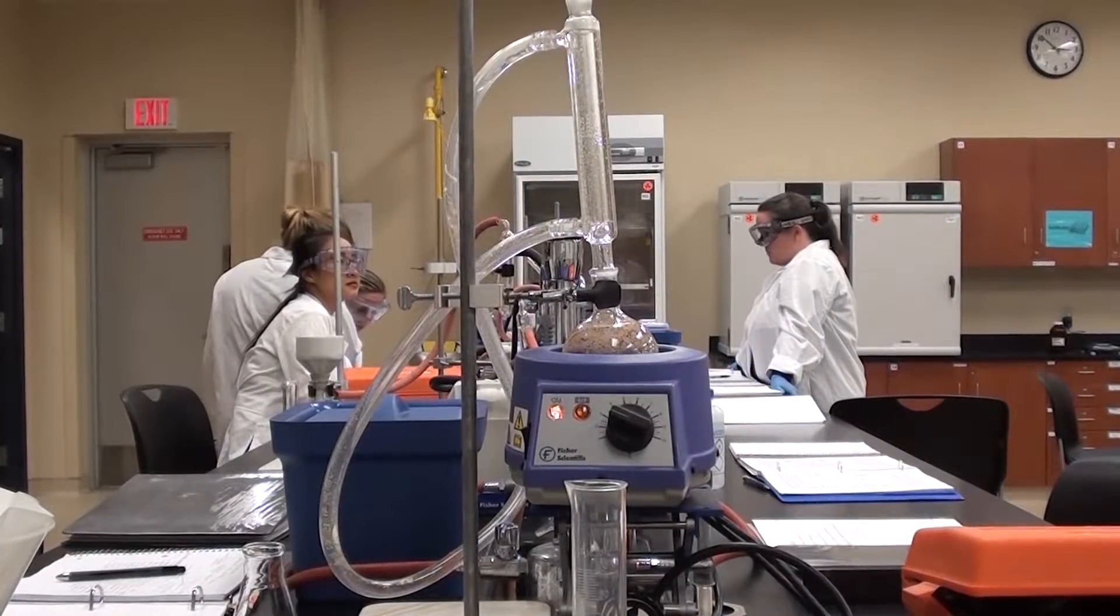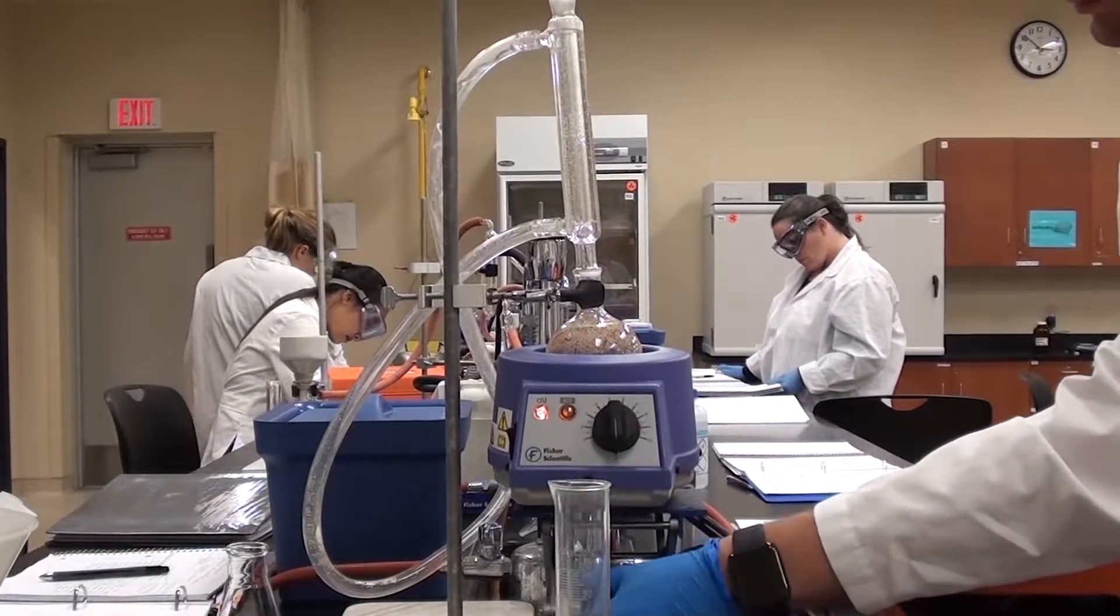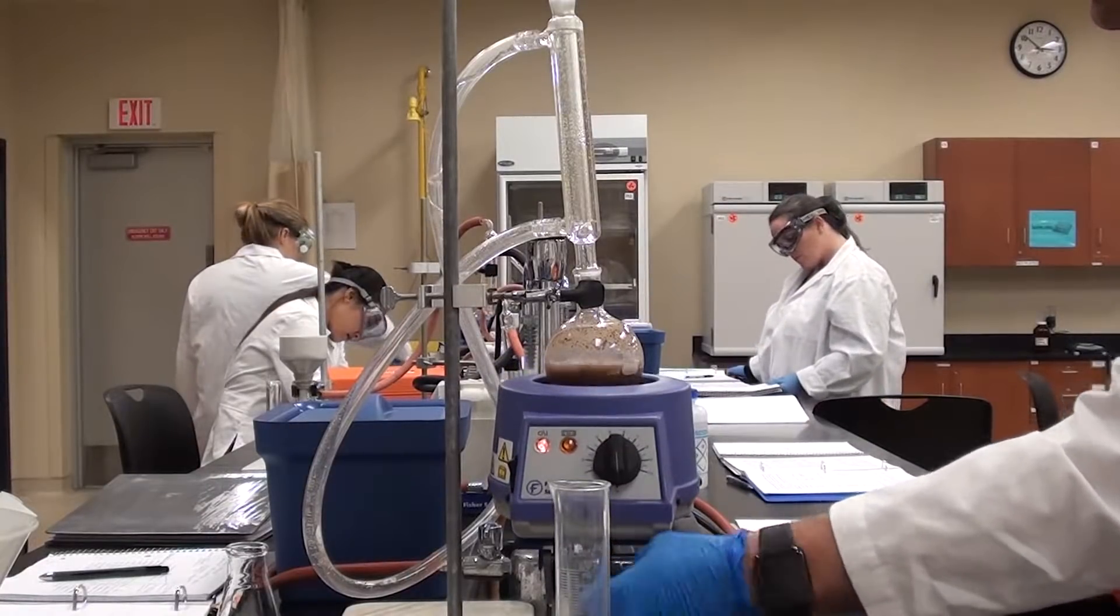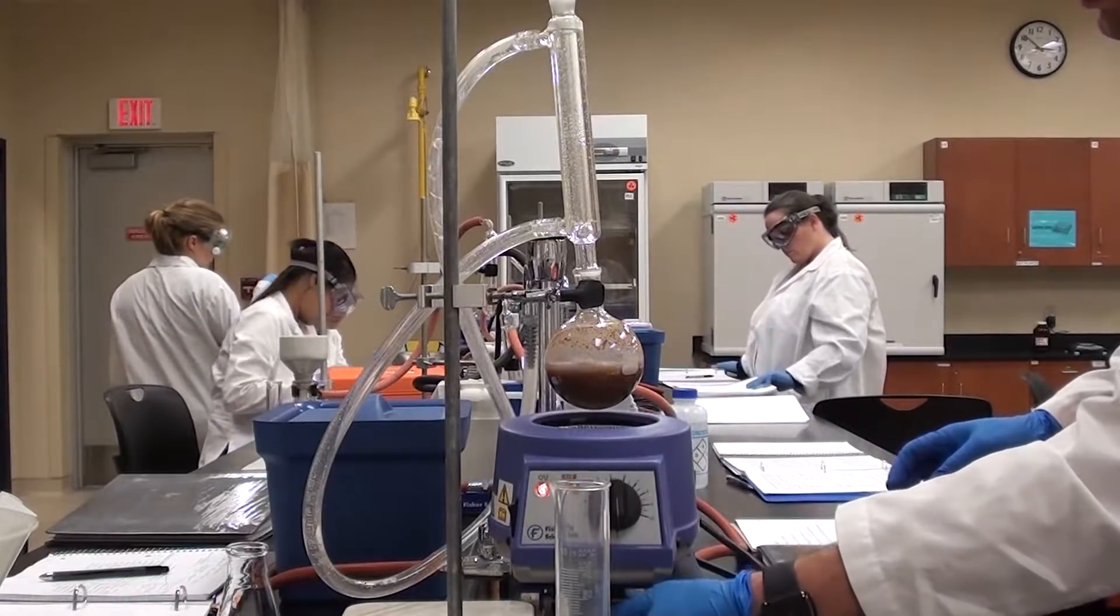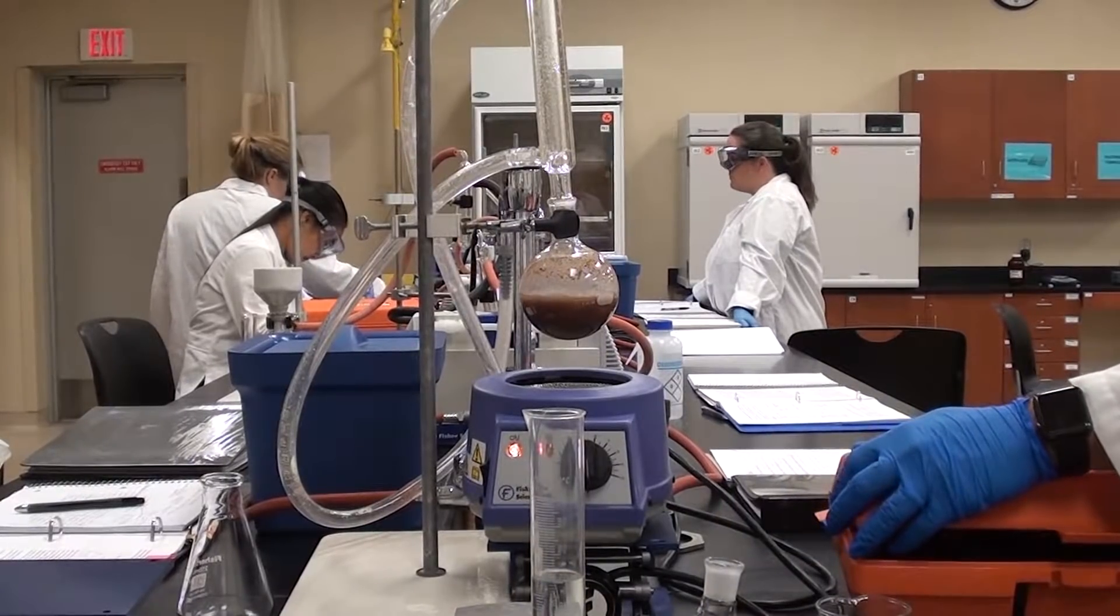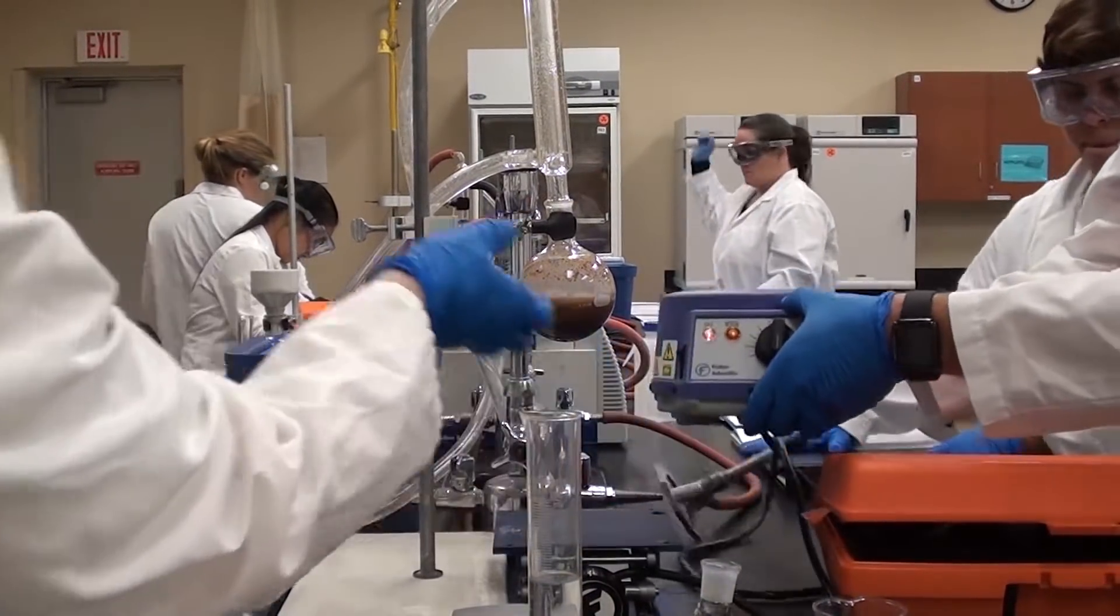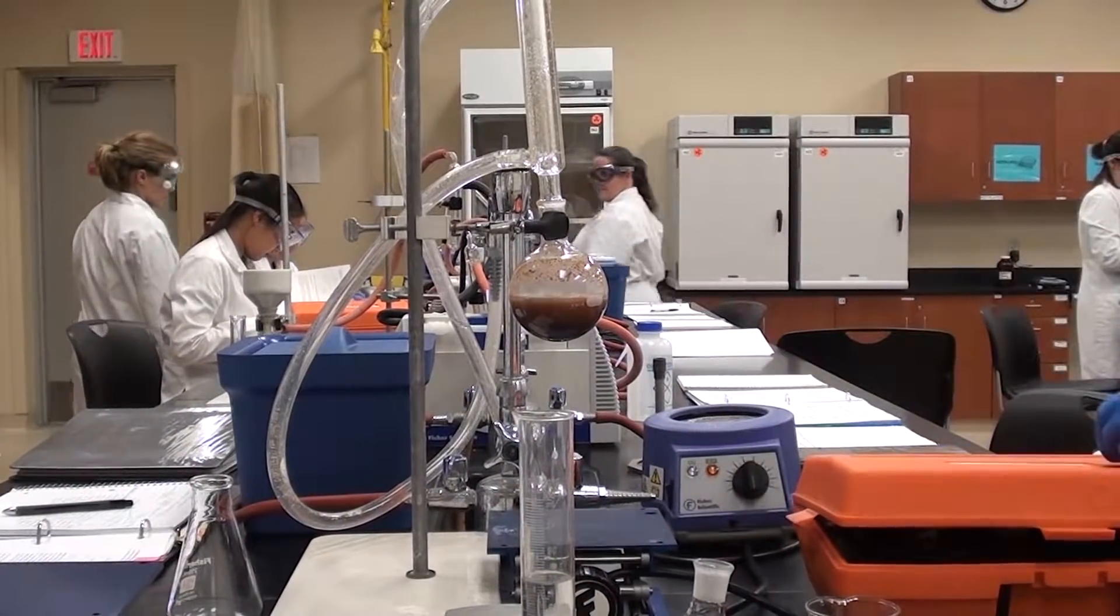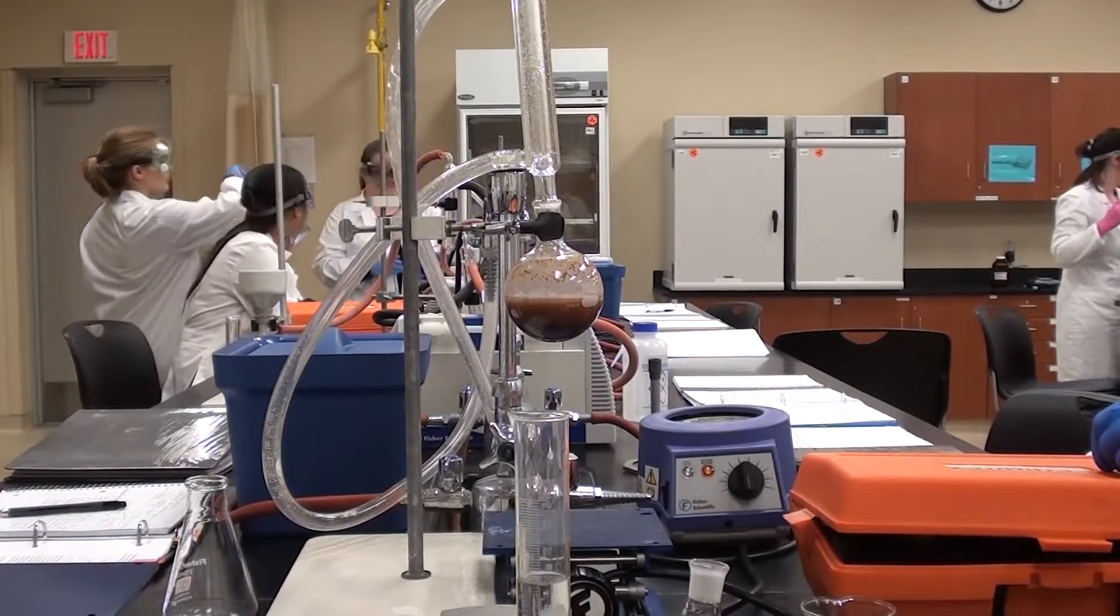Go ahead and turn it off now. What I want you to do is lower it and then take the heat right away from it so it's no longer underneath, because while it's underneath it would still be boiling anyway. Leave the condenser on there on the top but take that right away. The idea is that we're going to wait for this to stop boiling and then we will filter it.